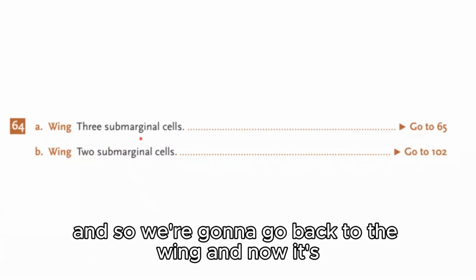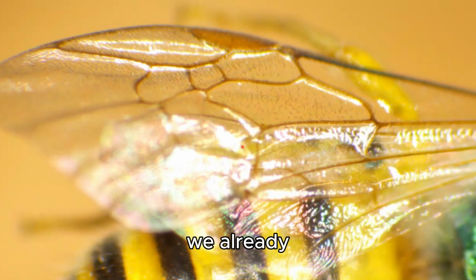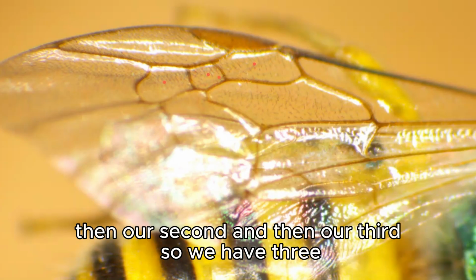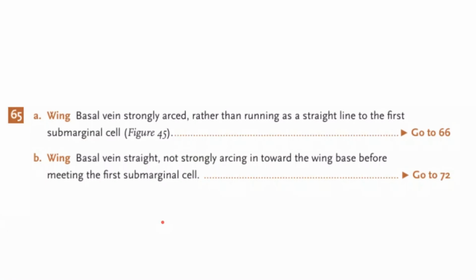And so we're going to go back to the wing, and now it's determining if it's the 3 or 2 submarginal cells. We already saw that there were 3, but here's an example again. We have our marginal cell, and then our first submarginal cell, then our second, and then our third. So we have 3. And so we will be moving to couplet 65.